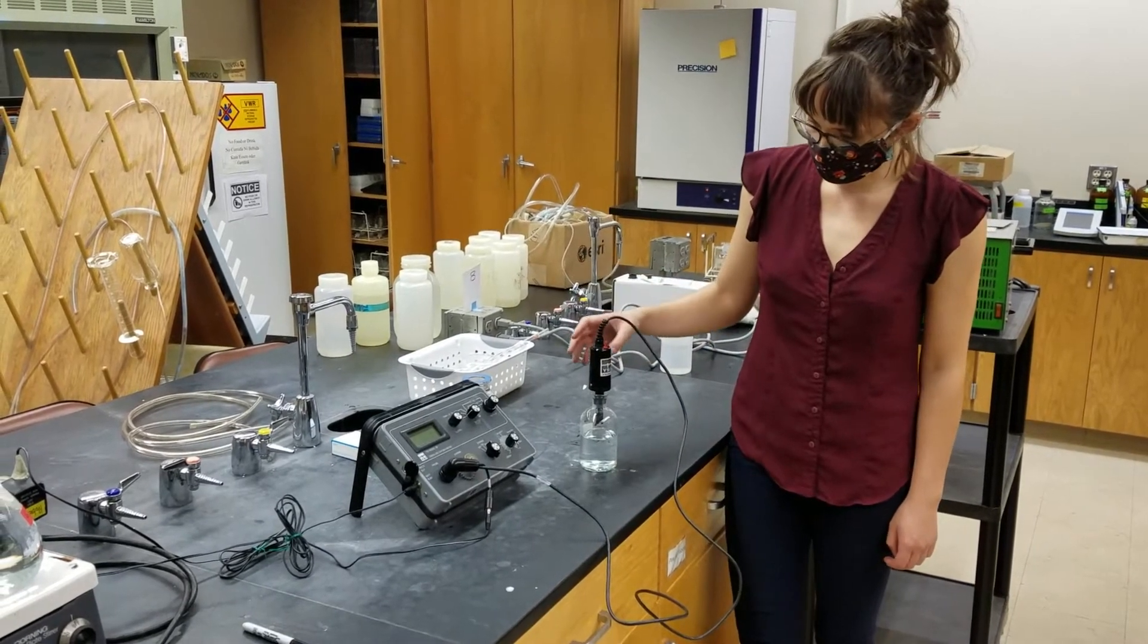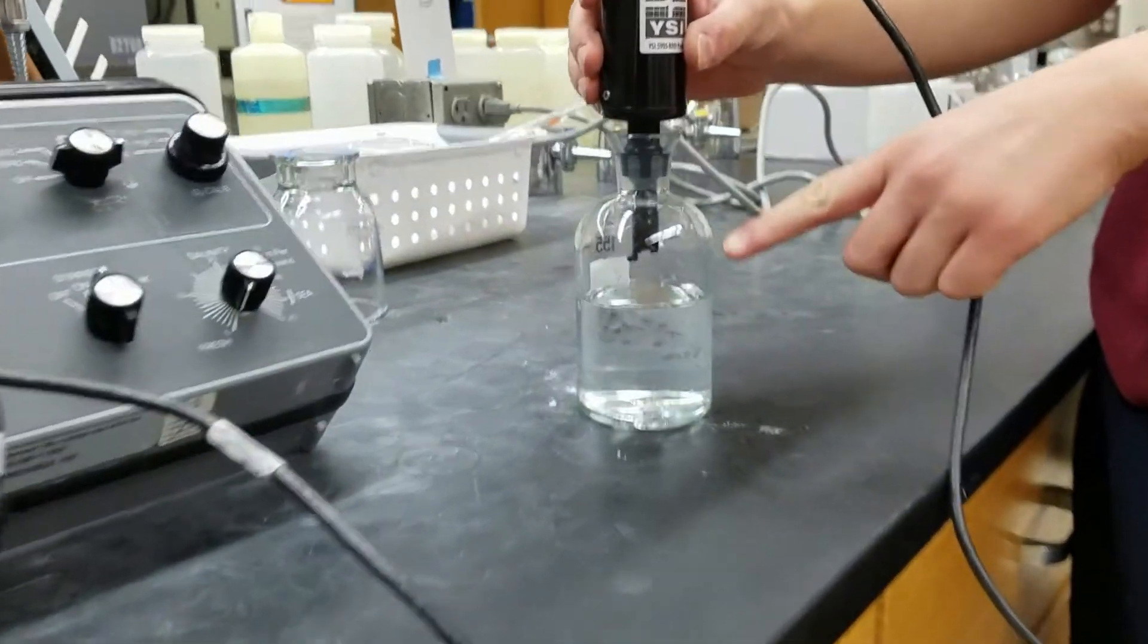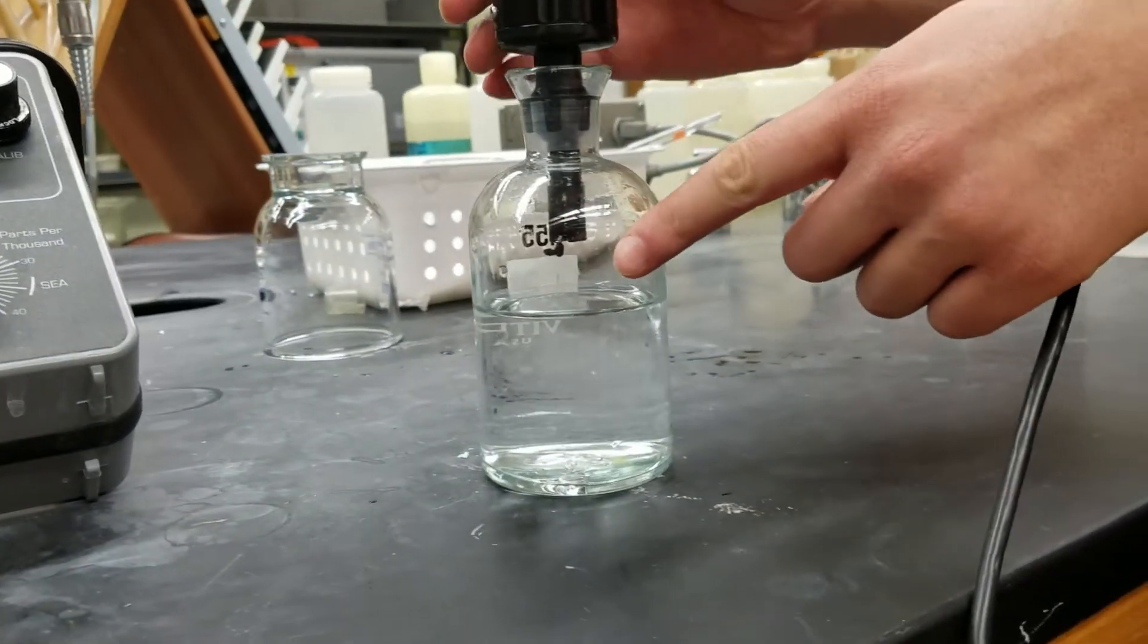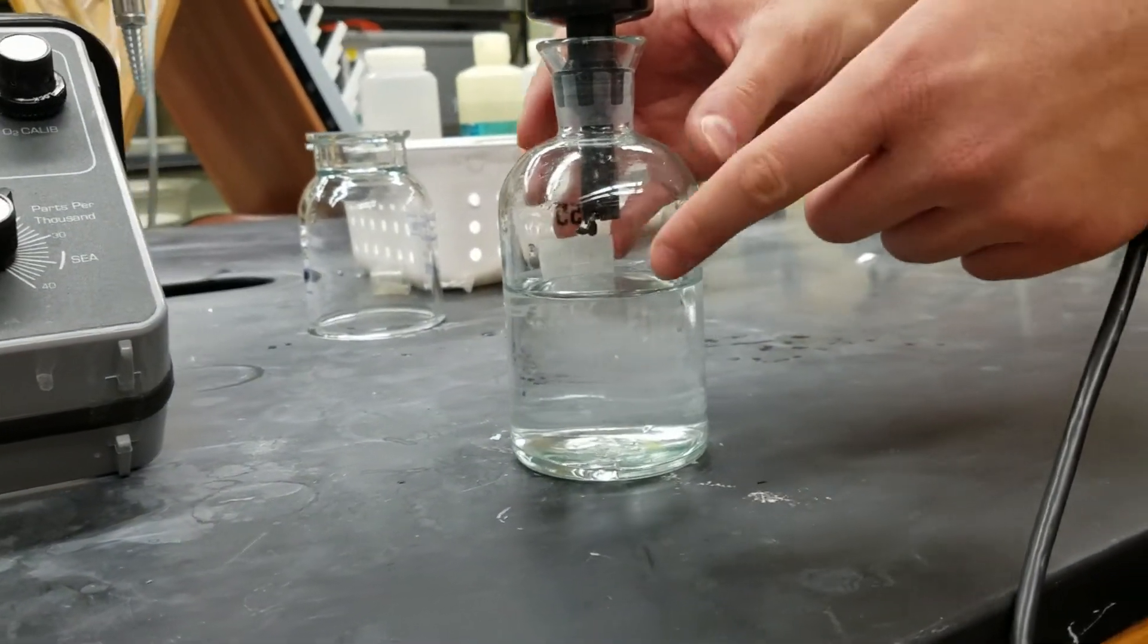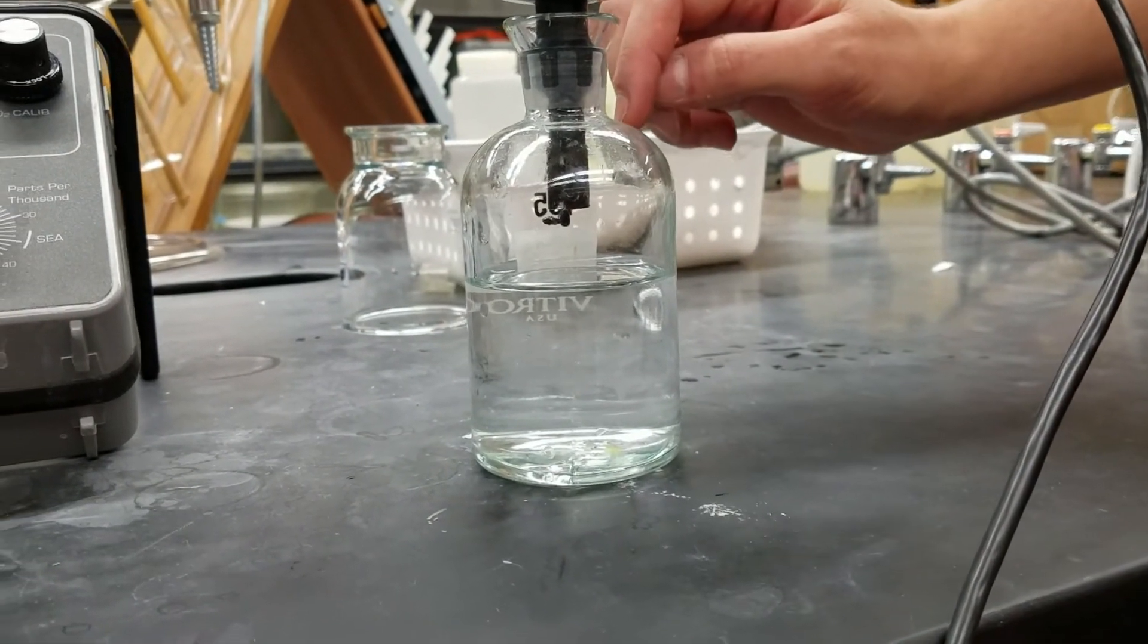So the first thing to notice is that when we calibrate it, we want to have it in oxygen saturated water in the bottle, but we don't want the probe to actually be touching the water. We want the probe to be in the air above the water.